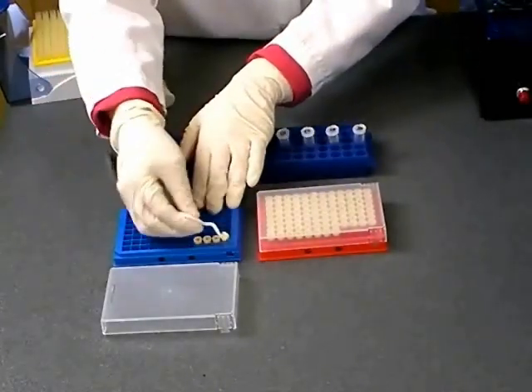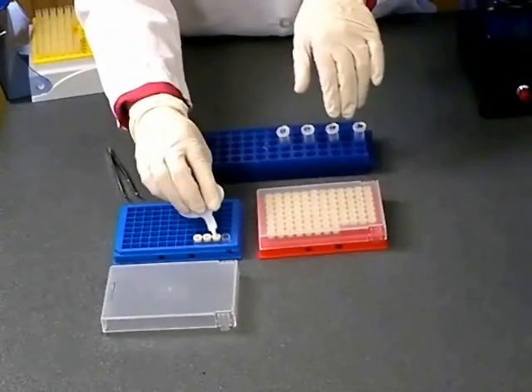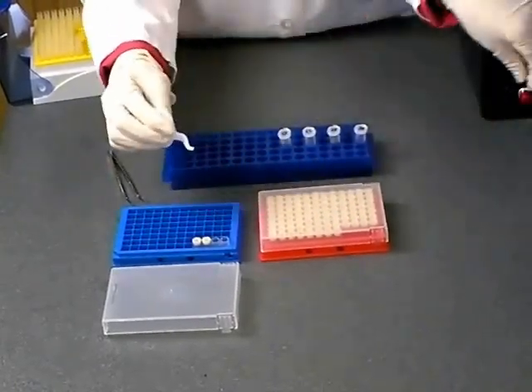Using the decapping tool, scoop off the lid from each Gentegra tube and discard.